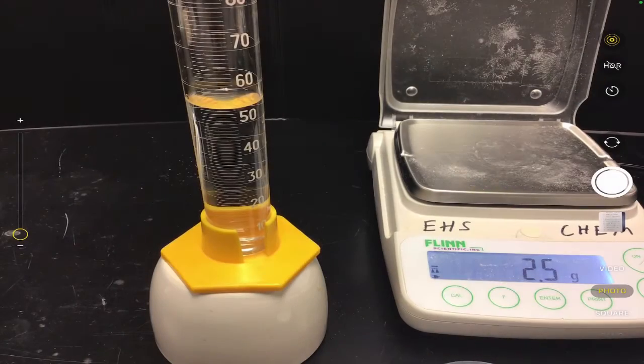What we have here is a setup where we're going to take a look at how to properly measure using mass and volume, and then use those measurements to figure out the concentration of a substance, okay? Now our goal here really isn't about solving for concentration. Our goal here is to follow the proper rules for measurement and then rounding calculated values, okay? So that's kind of our goal here.